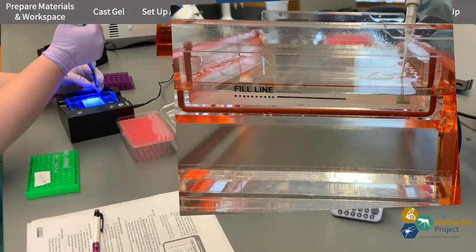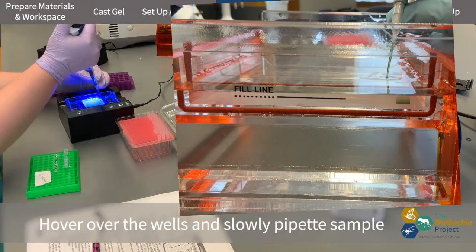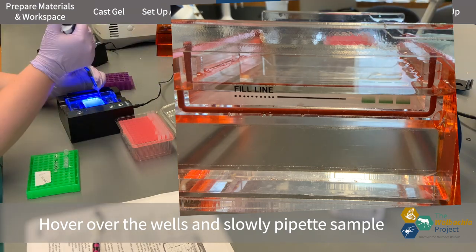To load your samples, you want your pipette tip to hover right above the well. The colored loading dye on your samples has some glycerol, so it is denser than water and will fall down into the well.